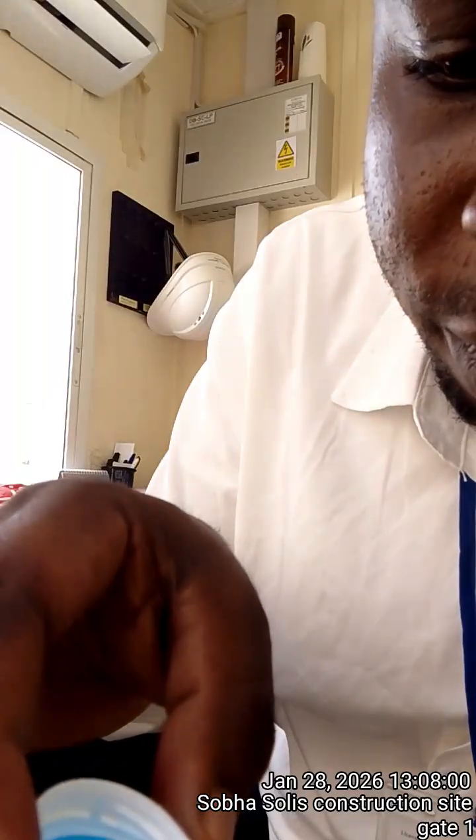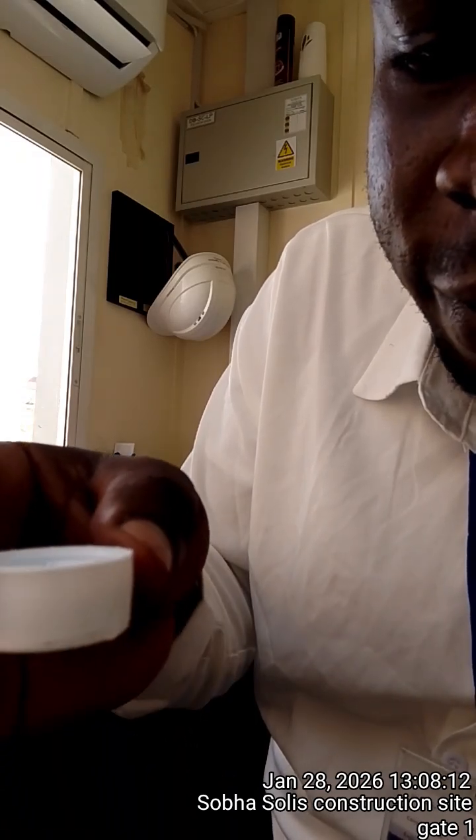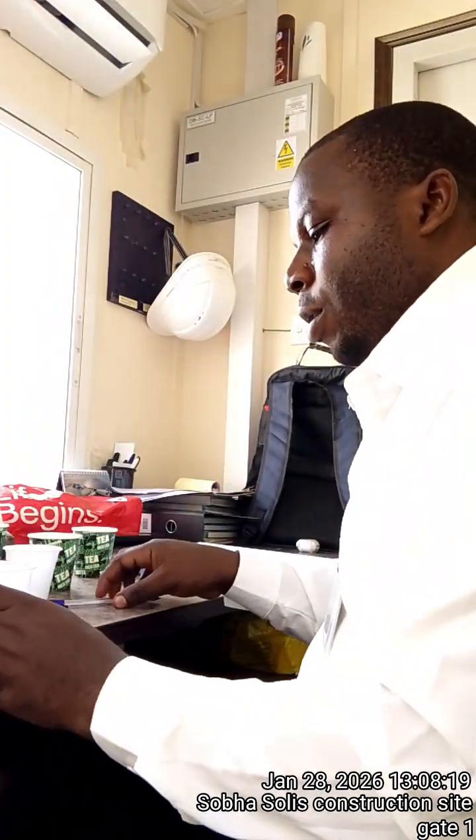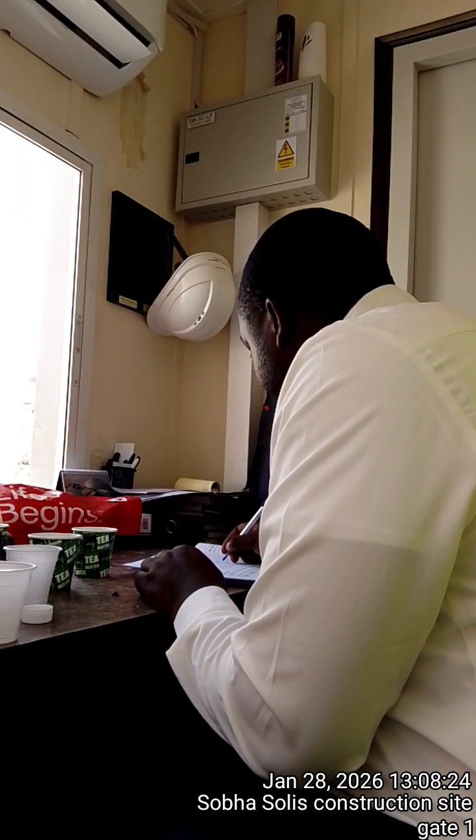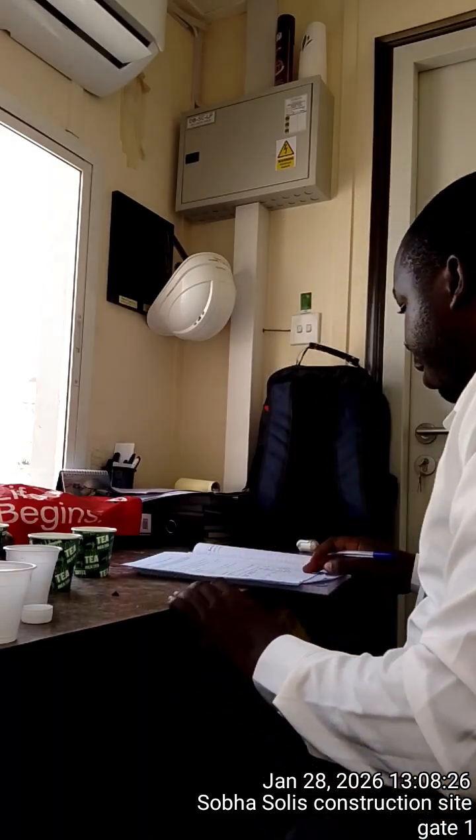Then this tap water also, I'm going to add very small. So immediately in this one, immediately the acetic acid dropped. Some moderate number of bubbles have shown. So also effervescence has happened.